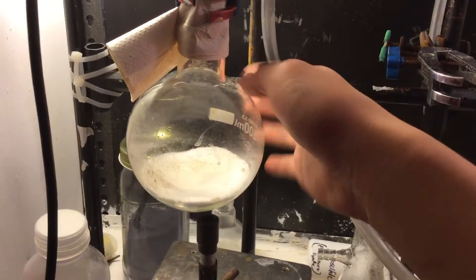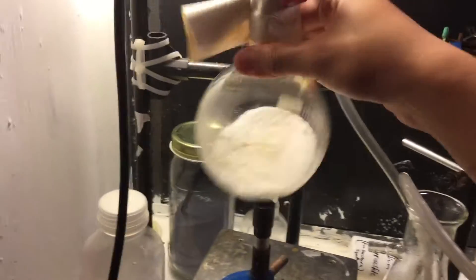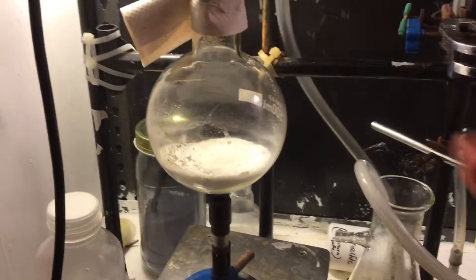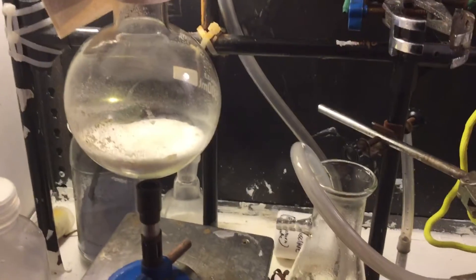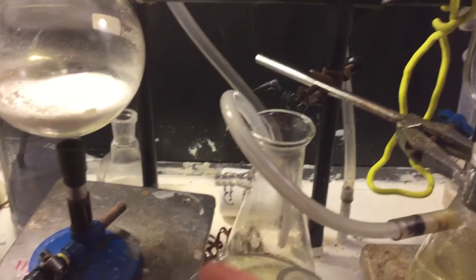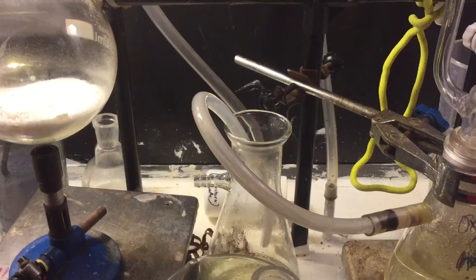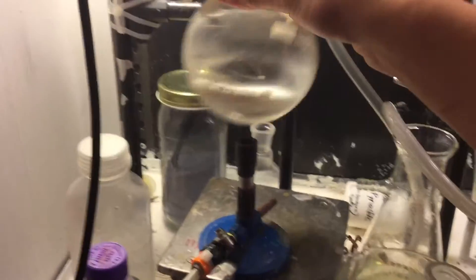This did not work, and it's all solidified into a brick. I think what might have happened is that I didn't dry it thoroughly enough, or it just sequestered a bit of water while in storage, because I just had that in a pill jar with some teflon tape on the threads, which obviously doesn't seal well.